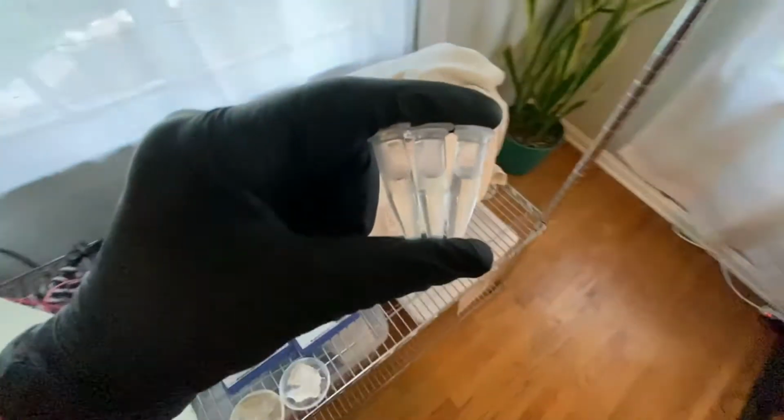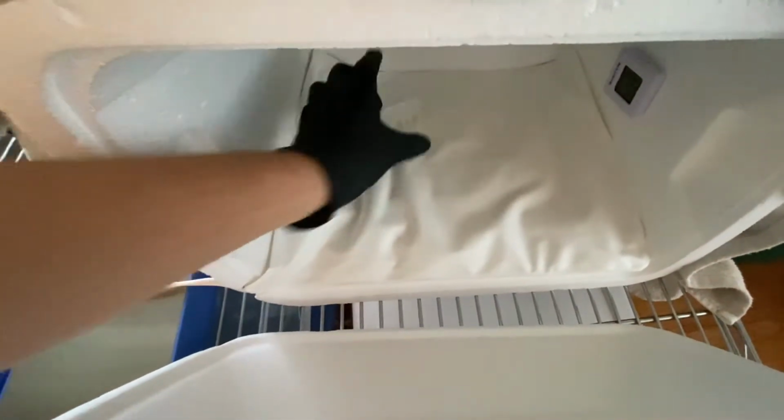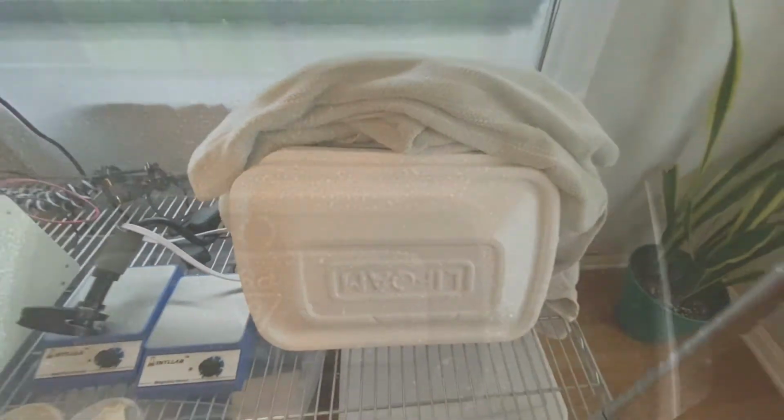And if they cloud over, then we know that our electroporation worked and we have a plate spreading problem, not a transformation issue. So let's give that a go and we'll check back and see what they look like in a couple of hours.